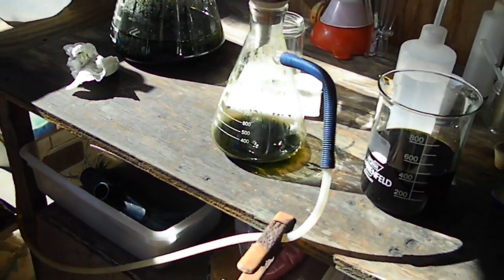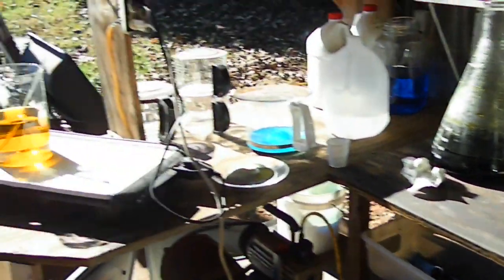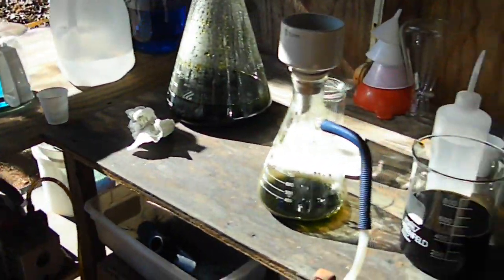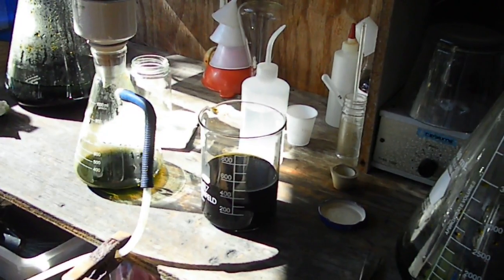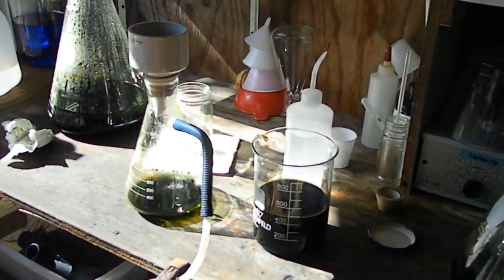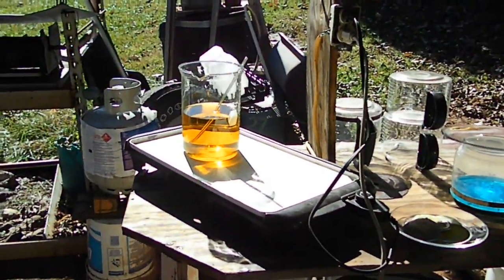I have an off-camera project over on the other bench. When this filters I'm going to hit that rinse acid in a few more minutes with some sodium metabisulfite and see if we can get a dusting out of it. This has just been a long process - between whatever this crap is in it and the stuff that interrupted me, it's just been a long refine. I'm not going to come in anymore until I'm actually going to drop that beaker or attempt to drop and see if we can get anything out of that - but that's mostly just iron and hydrochloric acid.